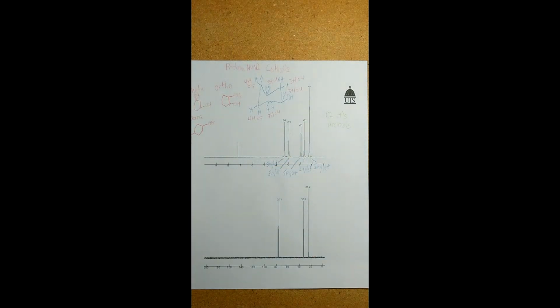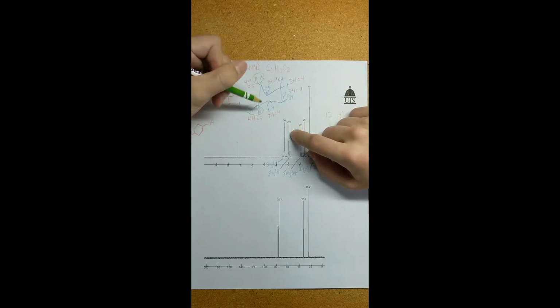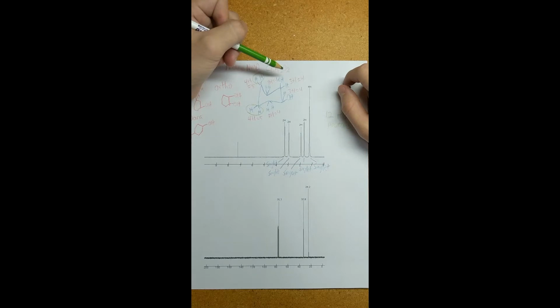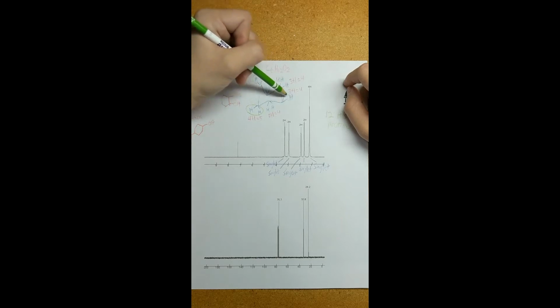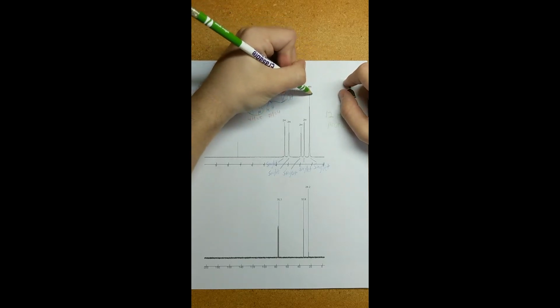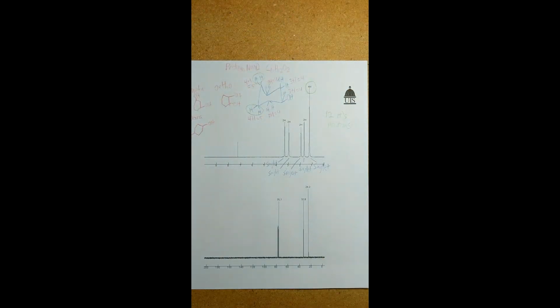Now that we have that, it's time to start figuring out what protons go where. Working from right to left, all the way to the right is going to be the least deshielded groups, which makes sense to be these two groups, as these 4 hydrogens match up with the 4 hydrogens on this integration, and they are the farthest groups away from these alcohol groups with the very electronegative oxygen atom. So we're going to label in green these two proton groups to go all the way to the right in the least deshielded position.